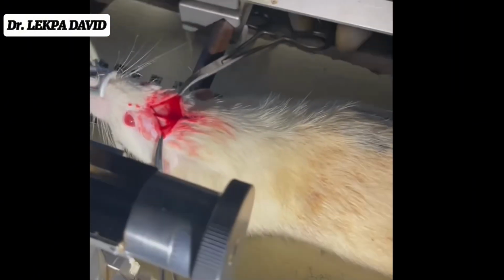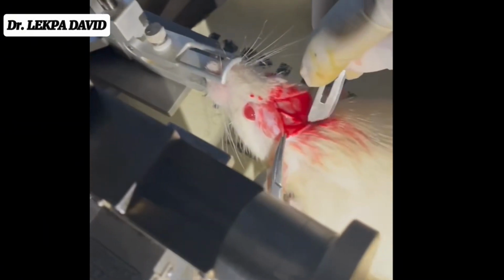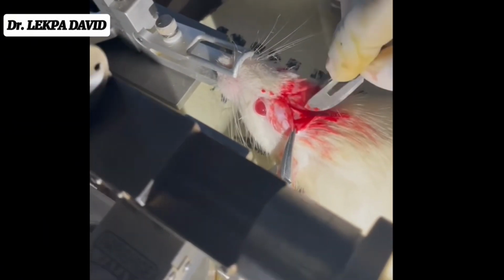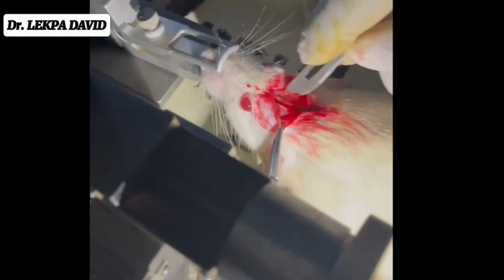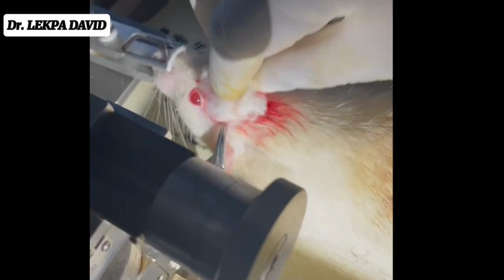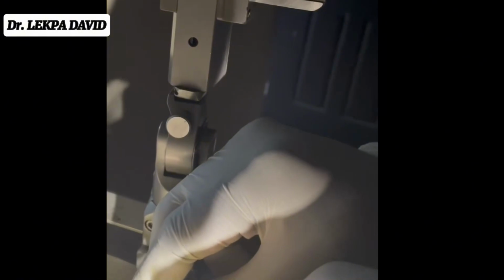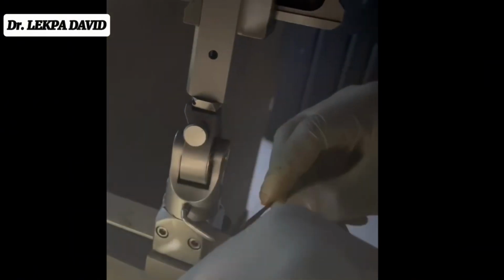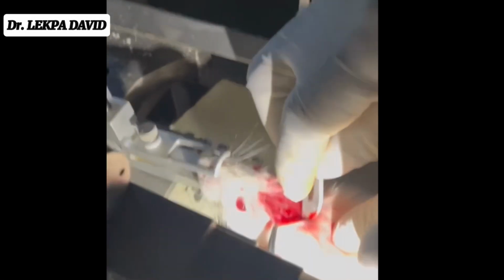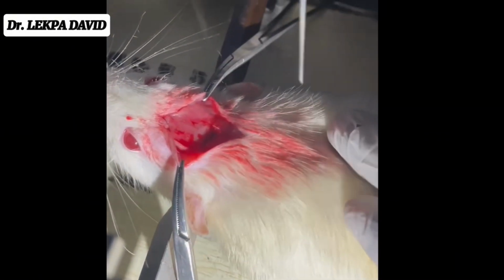Now, as you can see, the forceps have been used to separate the skin, and you can see me applying water, so I could be able to see clearly. In a moment, I'll be using the cotton wool to clean up the blood here. As you can see now, I'm doing that. It's quite bloody. That's a key landmark in this procedure, so we're trying to identify the landmark, the bregma. Still a lot of blood.